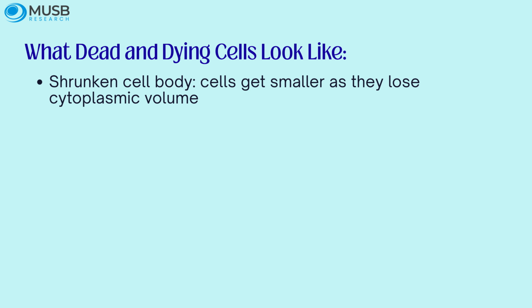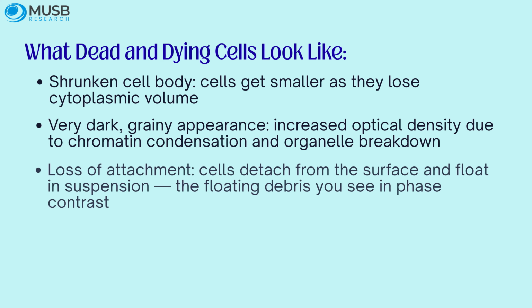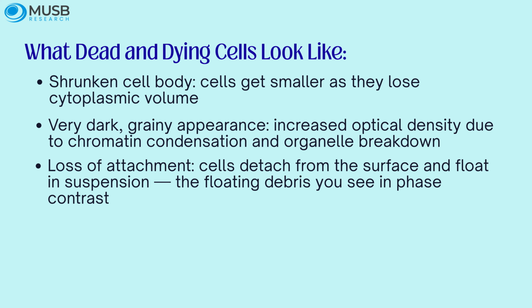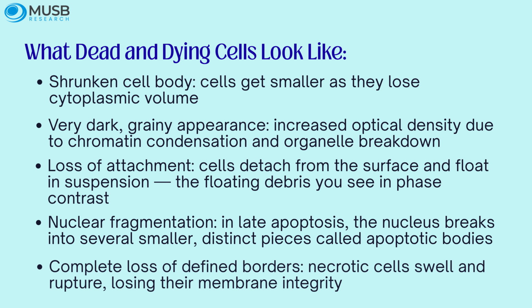Shrunken cell body. Cells get smaller as they lose cytoplasmic volume. Very dark, grainy appearance. Increased optical density due to chromatin condensation and organelle breakdown. Loss of attachment. Cells detach from the surface and float in suspension, the floating debris you see in phase contrast. Nuclear fragmentation. In late apoptosis, the nucleus breaks into several smaller, distinct pieces called apoptotic bodies. Complete loss of defined borders. Necrotic cells swell and rupture, losing their membrane integrity.